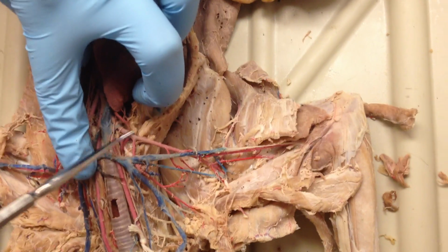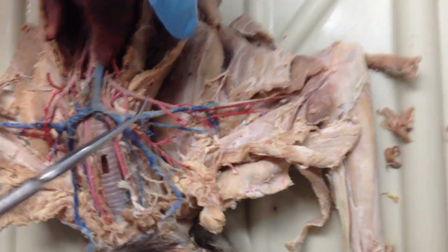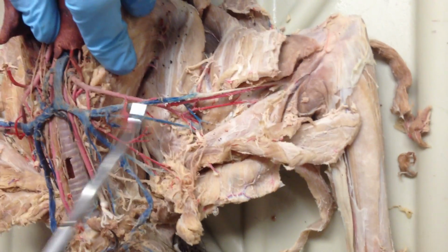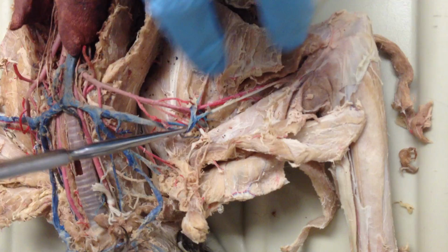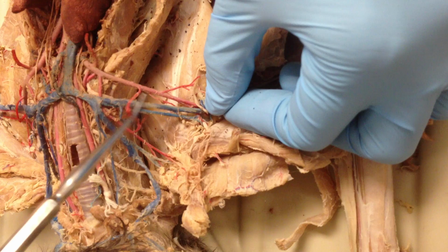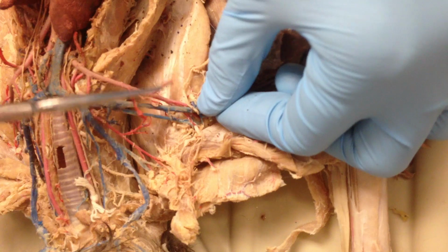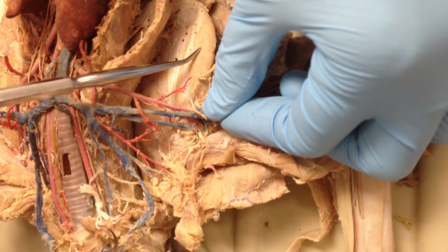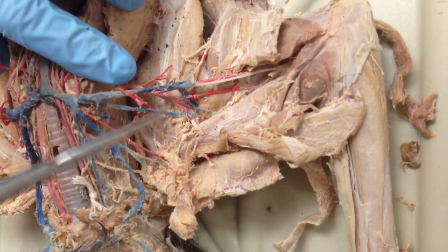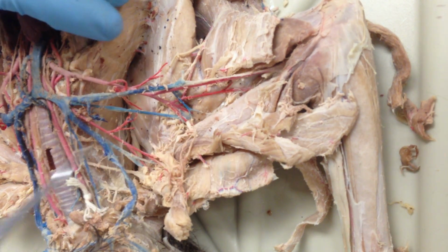Alright, so back to the subclavian, you see your first branch, now it's axillary. Now, unlike the vein, the artery doesn't have the subscapular coming off right away. The subscapular happens later. So you have your VLTs first. So in this case, it looks like this is your ventral thoracic, long thoracic next to it, and then thoracodorsal, which goes back towards the lat. And then you have your subscapular here. Once that subscapular branches, then your main line becomes the brachial. So slightly different.